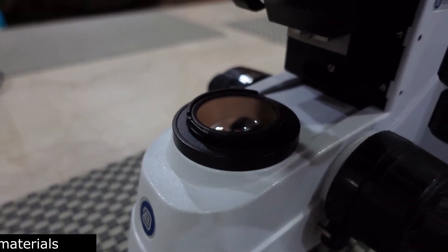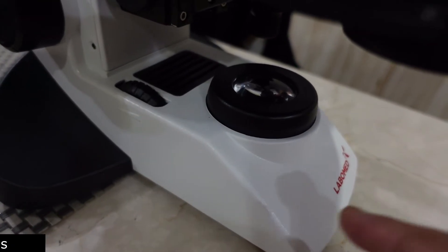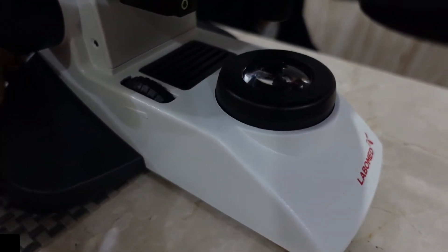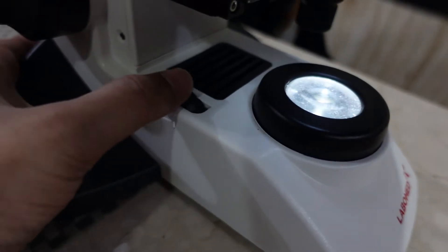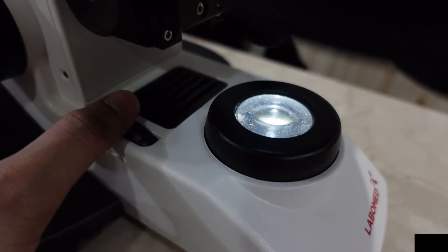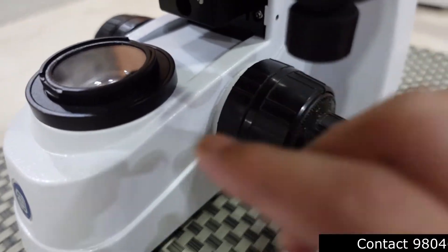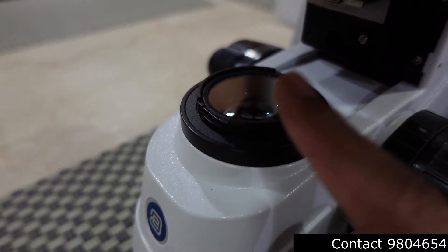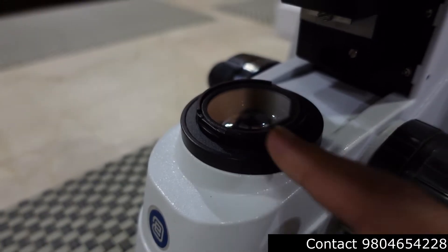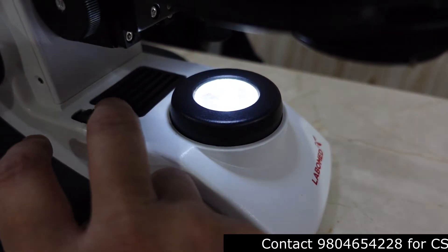The first thing is the light source — this is where the light comes in. I'll show you the light source of another microscope model. Here is a controlling knob where you can dim or increase the light intensity. In the back, there is a power cable and switches. The light source can be either halogen or LED.